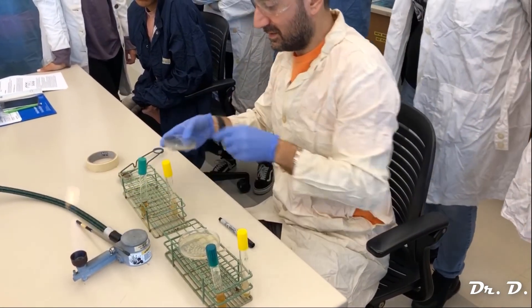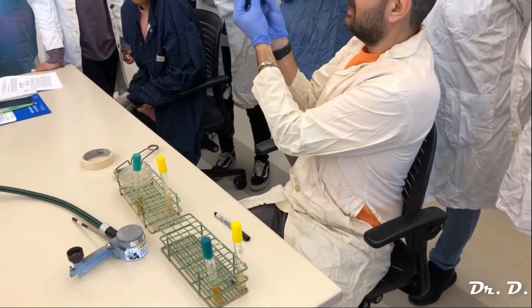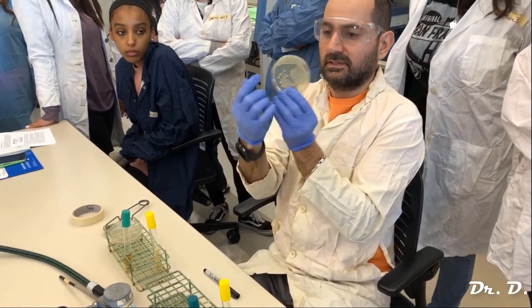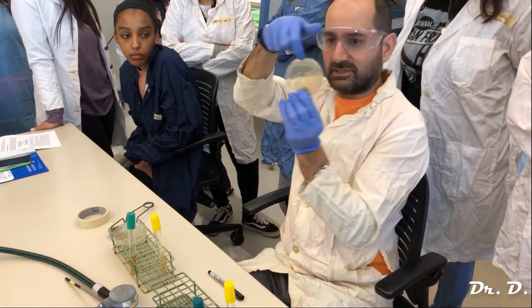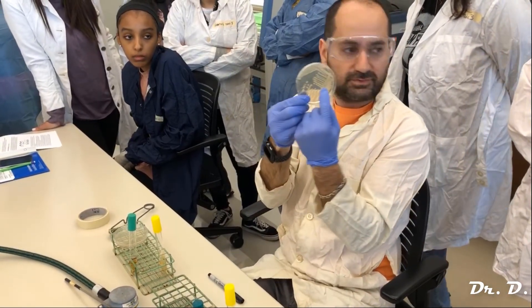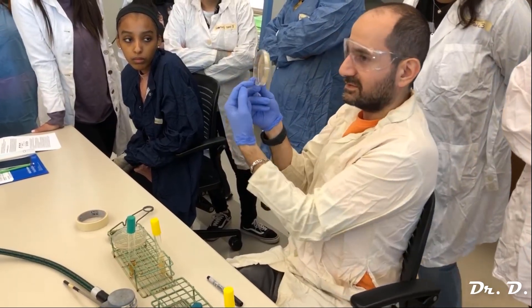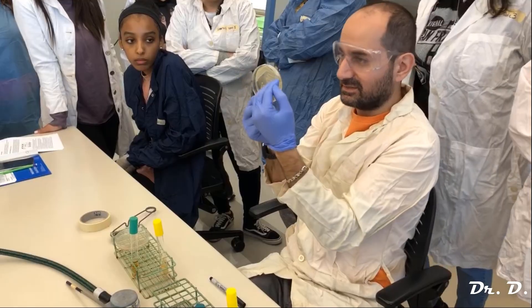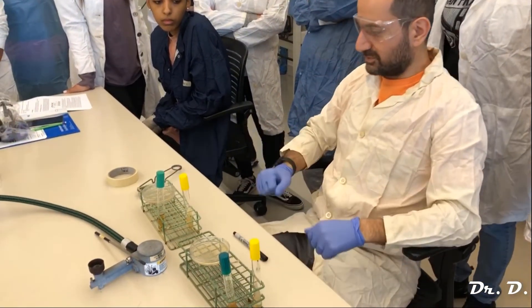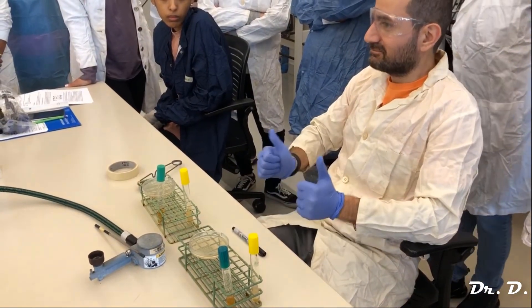Zone three is flamed, everything's done, and I can turn off the flame. That's why on a plate like this E. coli plate you can see: zone one, where you can't see any isolated colonies; zone two, which has fewer bacteria but still no isolated colonies; and then zone three, where you've got the isolated colonies because it's the most diluted. That's aseptic technique — that's how you properly conduct this kind of inoculation. Thanks, guys.